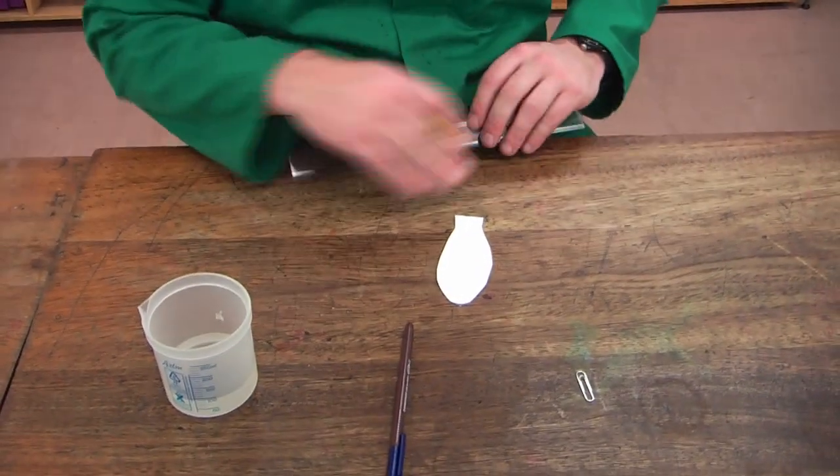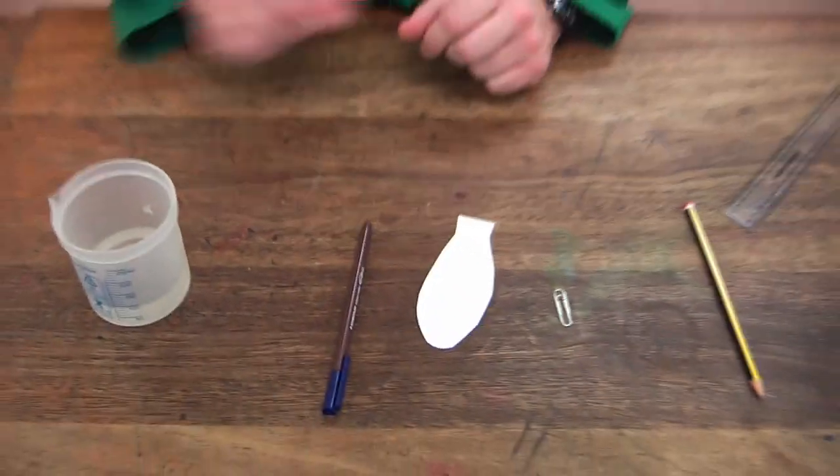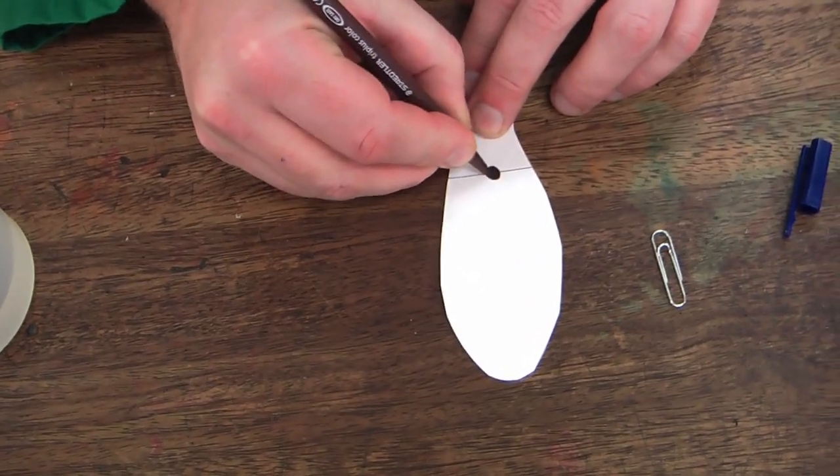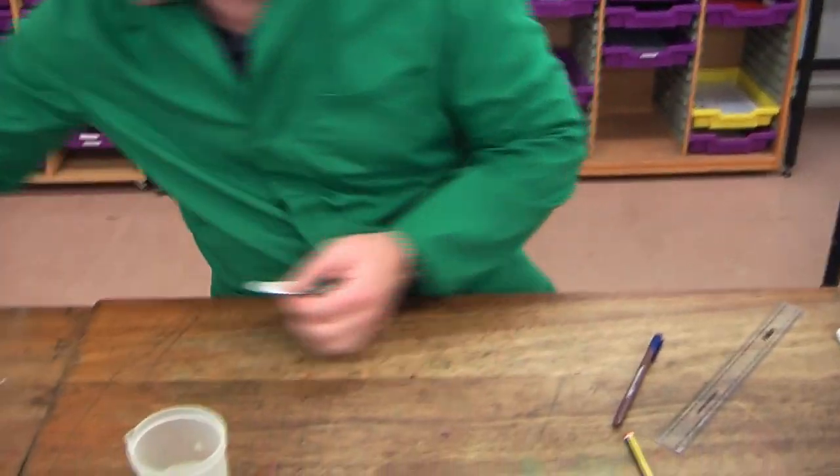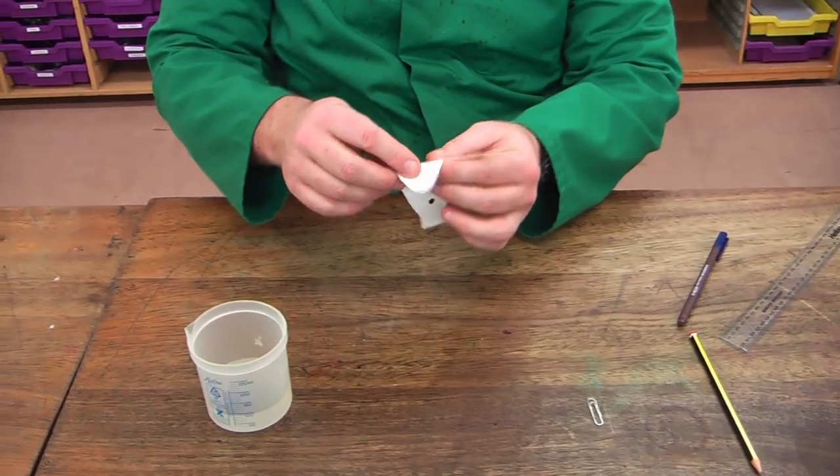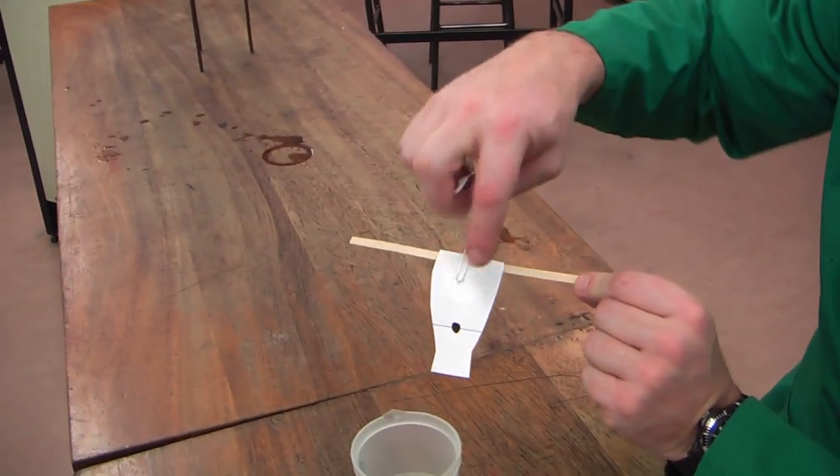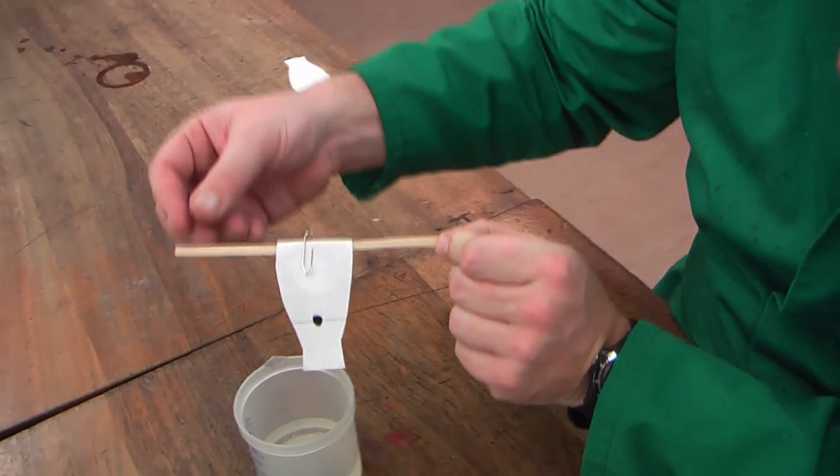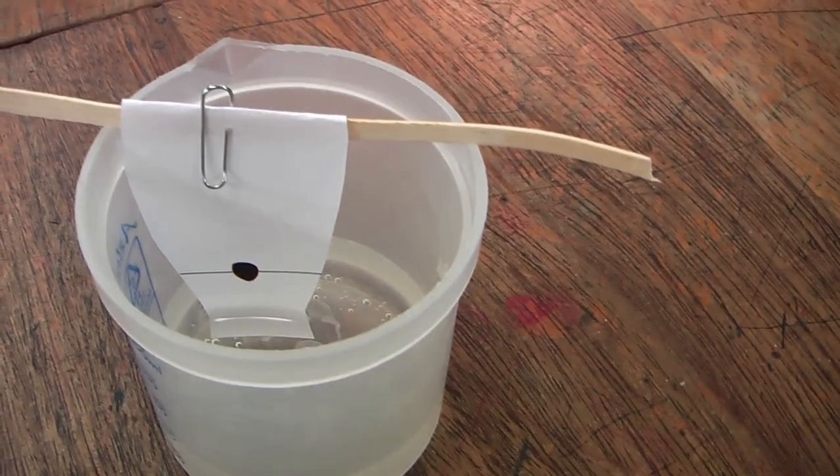So what do you need? You need a piece of folded paper, you need a pen, a ruler, a pencil, and a beaker of water with a little bit of water at the bottom. So what we're going to do, first stage, we're going to take our piece of paper, it doesn't have to be shaped like this, it's just the paper as I found it, and we're going to put a pencil line across the bottom. It's important we use pencil, because pencil is insoluble in water, and that will not dissolve or move in the water. Onto that line, we are going to put a dot of the ink that we are going to use. In this case, I've got a brown colour. That we then take, and we're going to use a splint, it doesn't have to be a splint. I'm just going to fold it over and paper clip it so it stays secure. So here is my point, my pencil line, and filter paper. Now I'm going to put that in, and it's important that the water level is below the line of the pencil. So I put this into here, and you can hopefully see inside there that the water line is a little bit away from the pencil line.